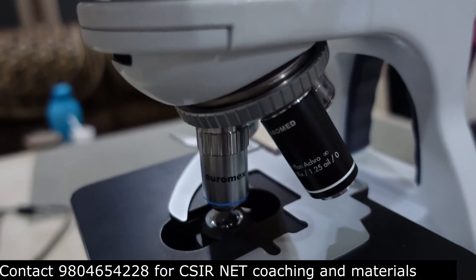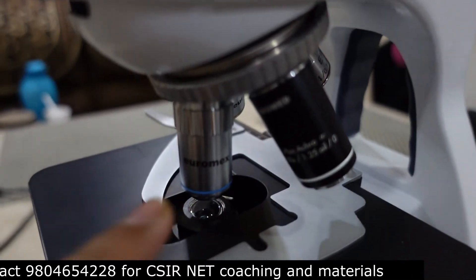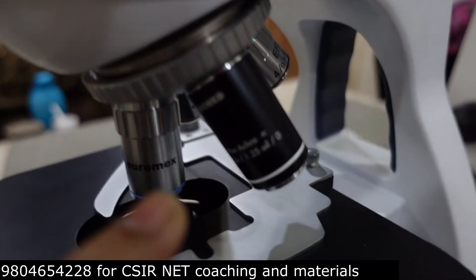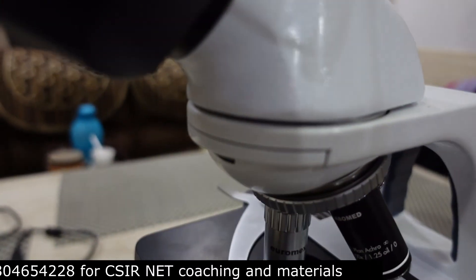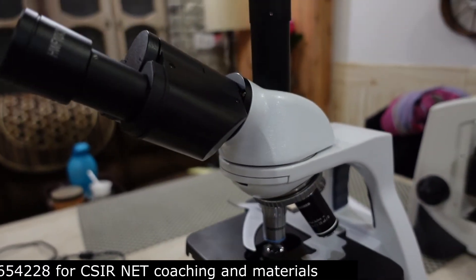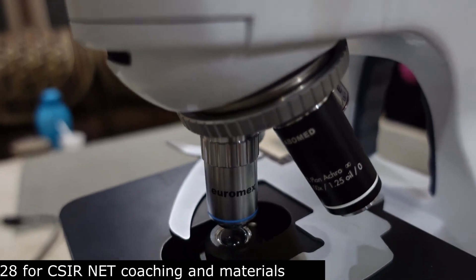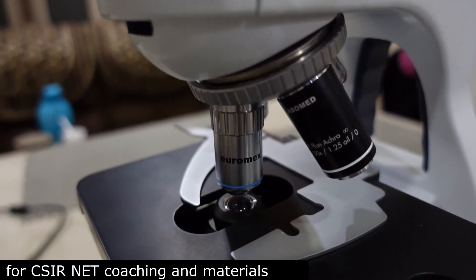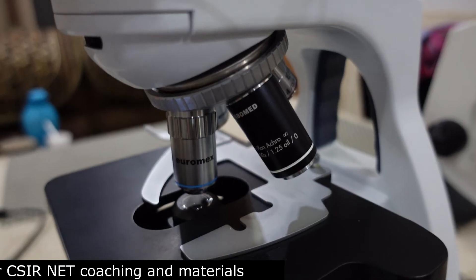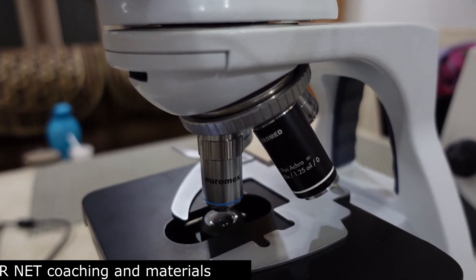Based on the objective lenses available: 4x × 10x = 40x, 10x × 10x = 100x, 40x × 10x = 400x, and 100x × 10x = 1000x. So the highest magnification possible with this microscope is 1000x and the lowest is 40x. These are all the different components of a light microscope.